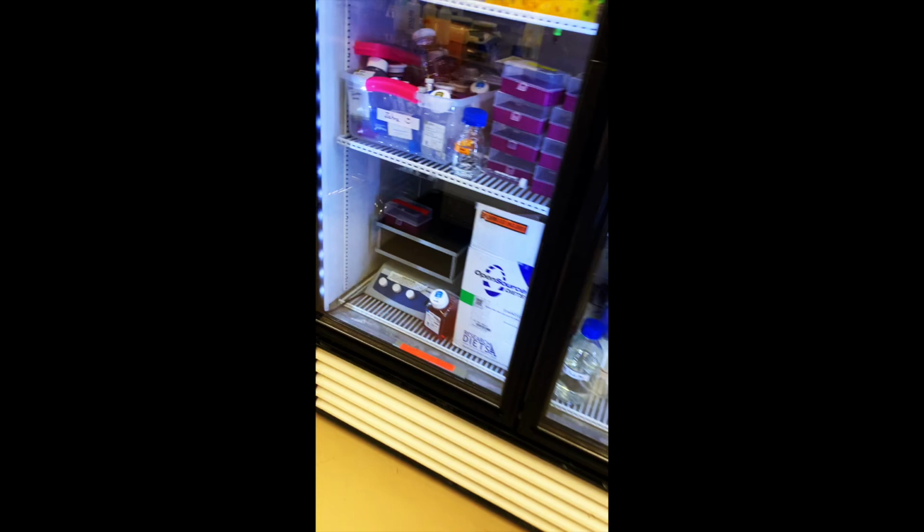And so rockers are really useful because when we have a membrane, we need it to be evenly coated with the antibodies to be able to detect the protein that we're looking for. And so one part of the process is where it needs to be incubated overnight. And so this rocker here moves back and forth to allow that antibody solution to evenly coat the entire membrane. So that way we can come back the next day and use another machine to look at the proteins that the antibody found.